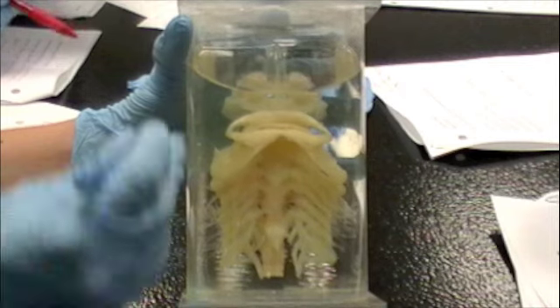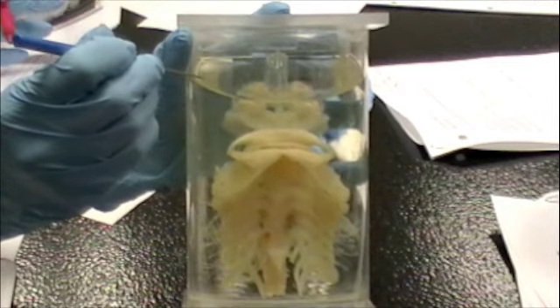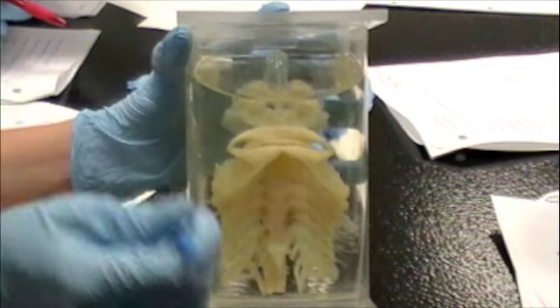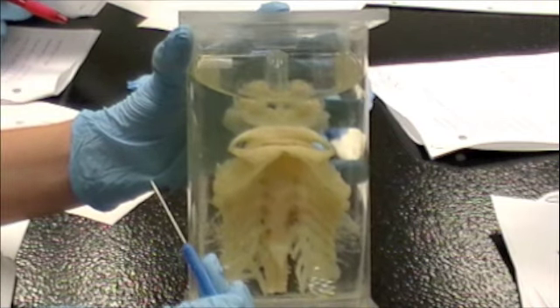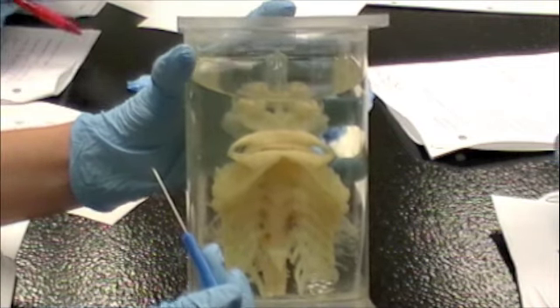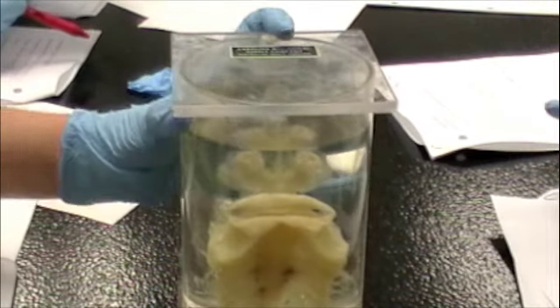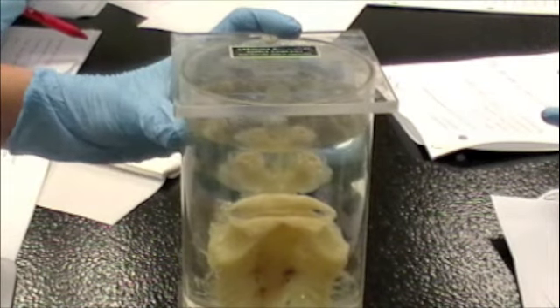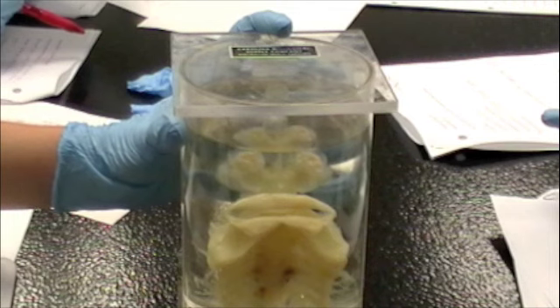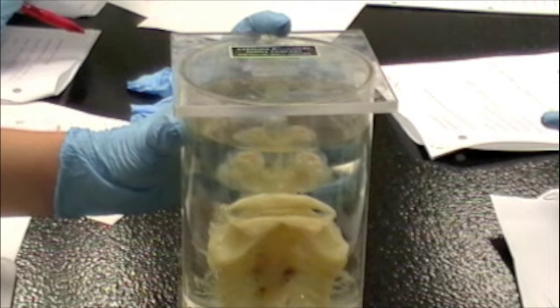The nasal capsule — those things that are filled with little structures inside. Those are actually the lamellae, where they sense smell. You guys are actually going to dissect those out.